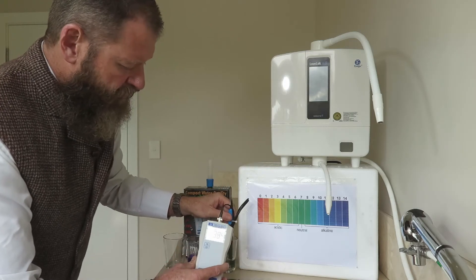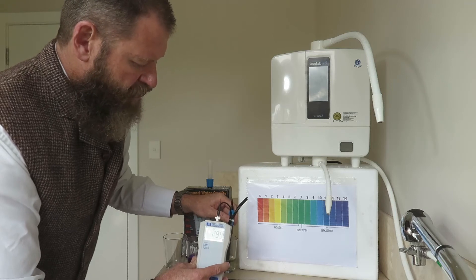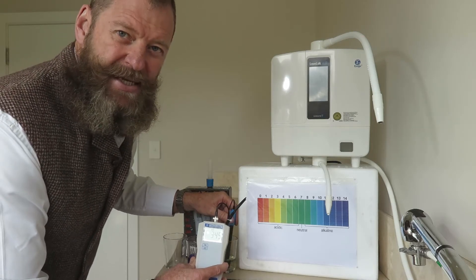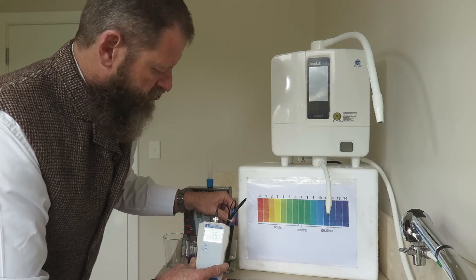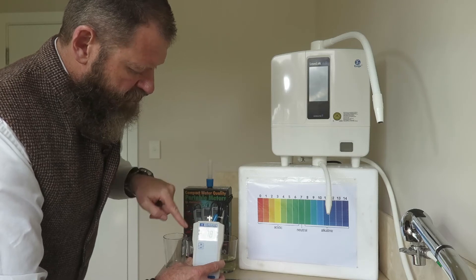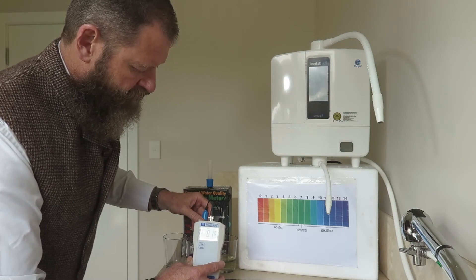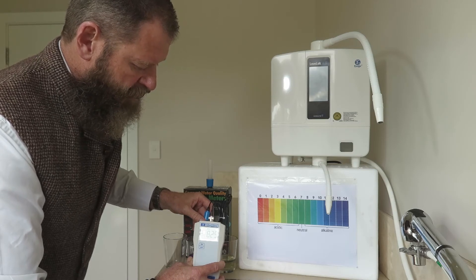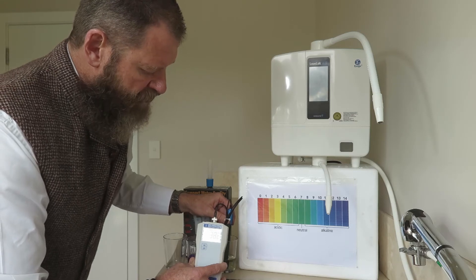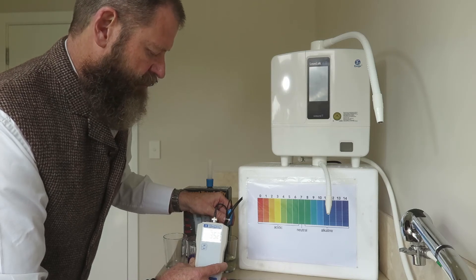I put this into my acidic water again and give it a twirl — it is in the positive 300s. These things take time, so don't rush them; put the kettle on and have a cup of tea. It's at 351. I'll move it back to my alkalized water — can you see that number there? It's jumped straight into the negative: negative 807. Back into the acidic again, and once the number stops, my machine is calibrated. I'm happy with it sitting at 352.